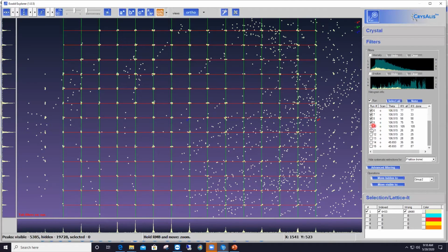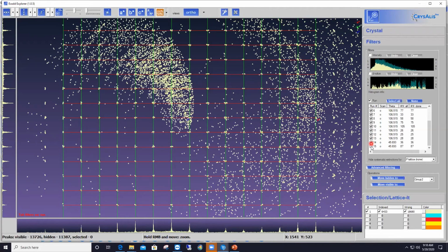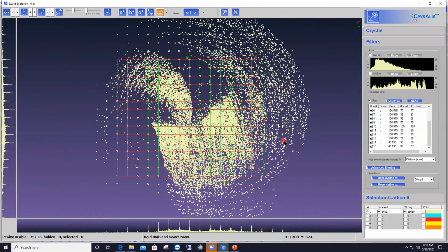Now as I bring more and more scans into the display, the ice features appear worse and worse. So remember the run feature in the filters tab that allows you to see the evolution of your data during data collection, so you can check whether something went wrong during data collection or not. And here I can tell that almost half of my dataset is just fine and clean.